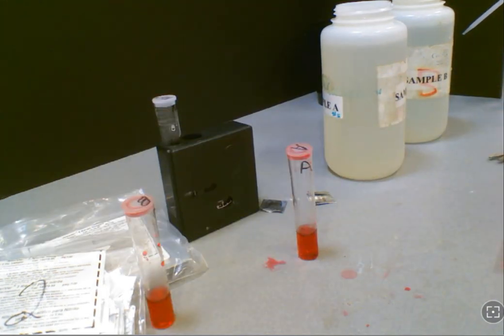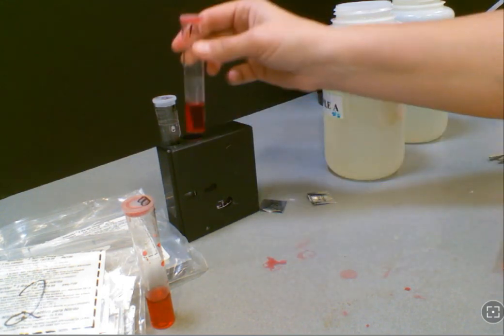After you've waited your 10 minutes you're going to go ahead and take sample A and put it into the empty slot in the color comparator.